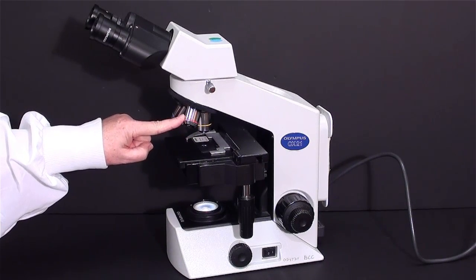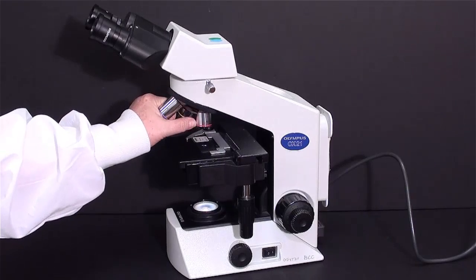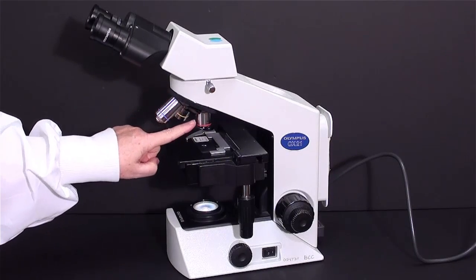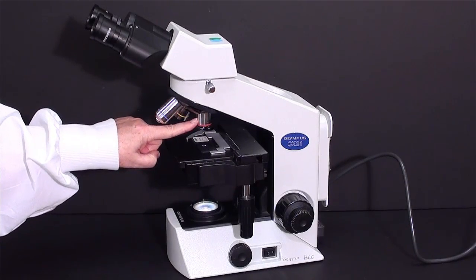The scanning lens is the weakest lens. It's a 4x lens. When you're using this one, the total magnification is 40.